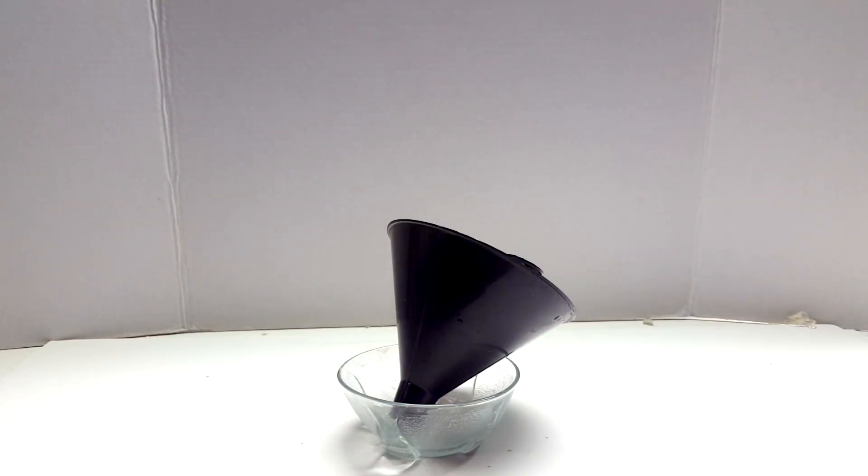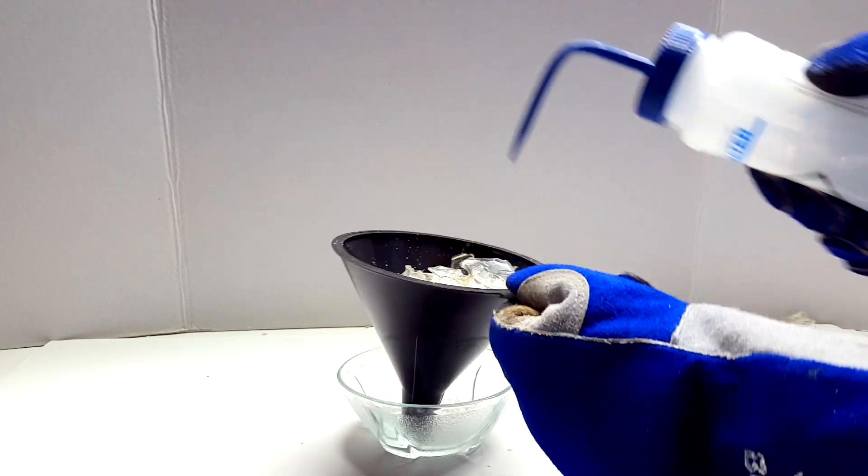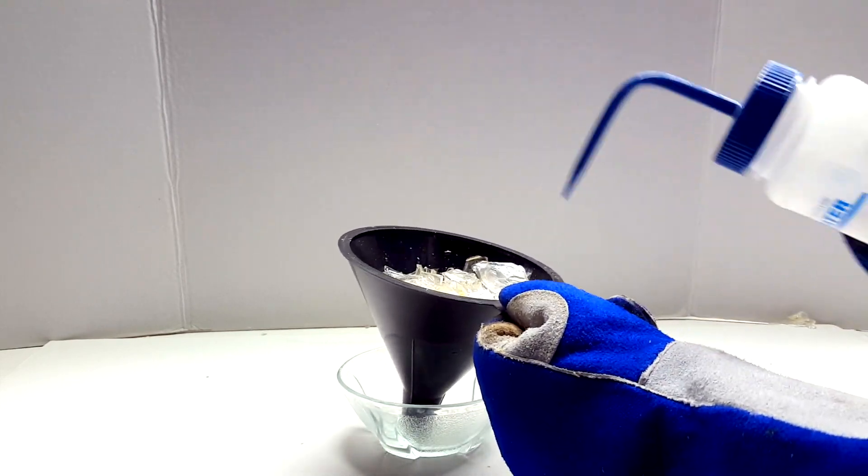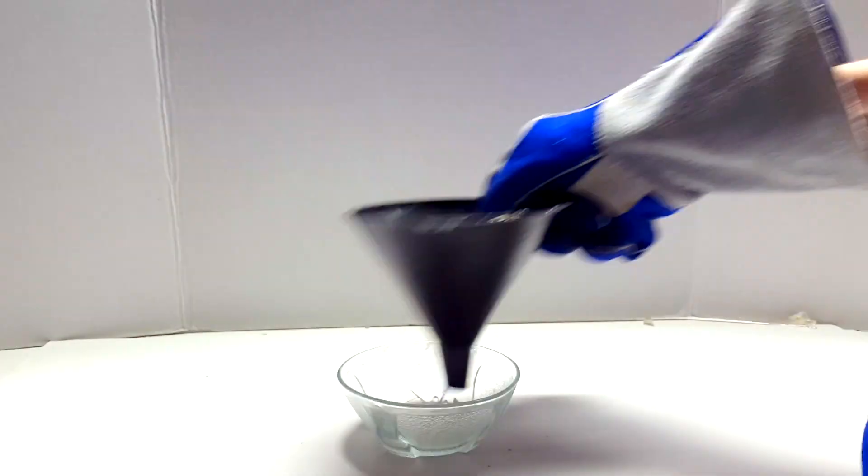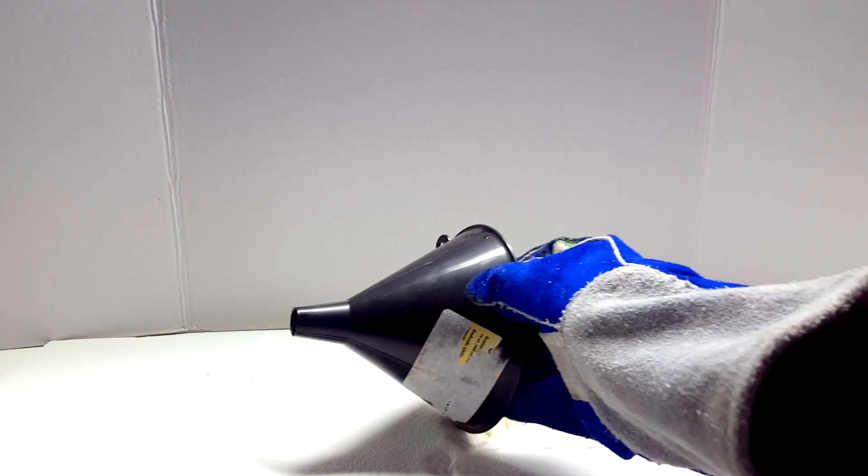I placed down a piece of white cardboard and moved onto the washing steps. The glass shards in the funnel were washed with a squirt bottle and water a few times. This not only cleans the glass pieces, but removes some of the more dust size particles of glass. Then I laid out a paper towel and placed the glass on it to dry.